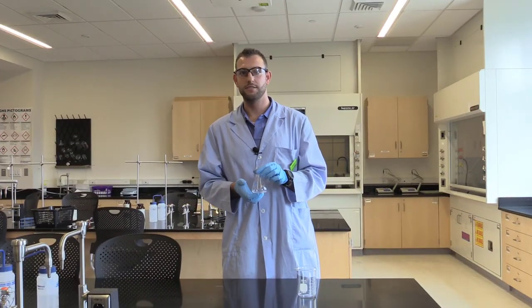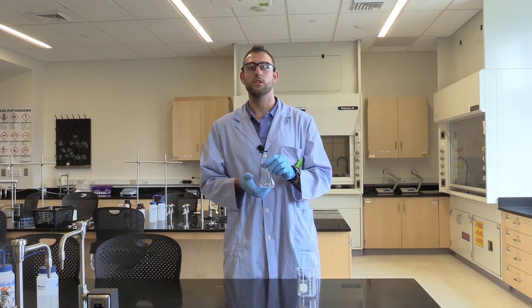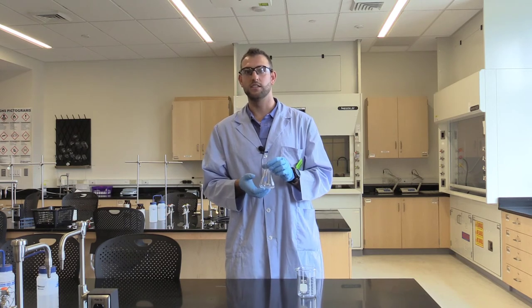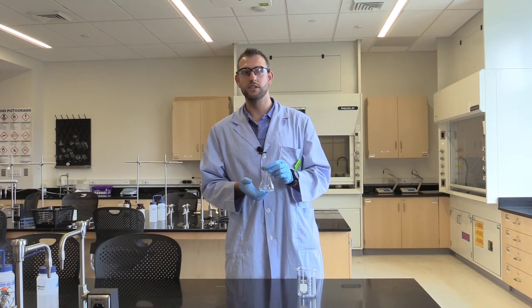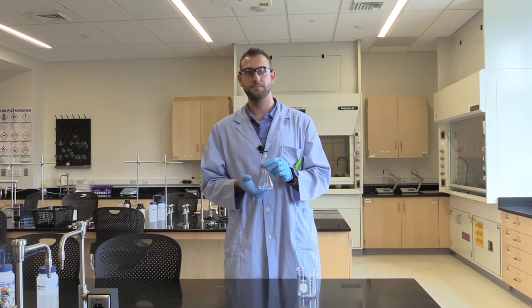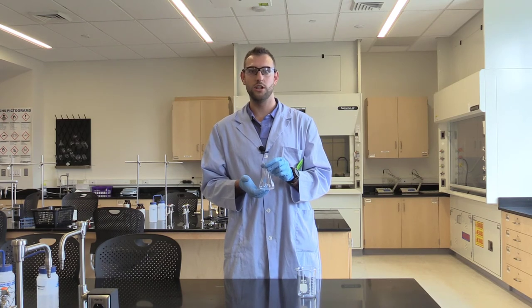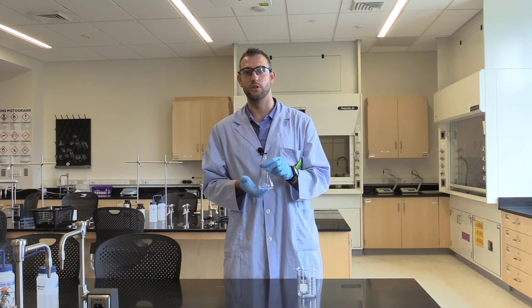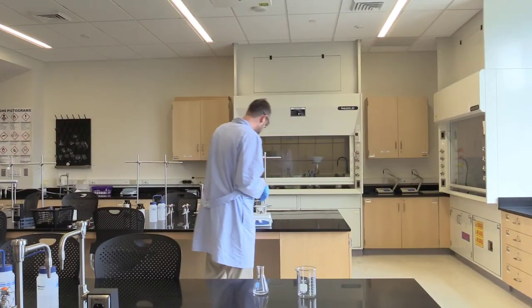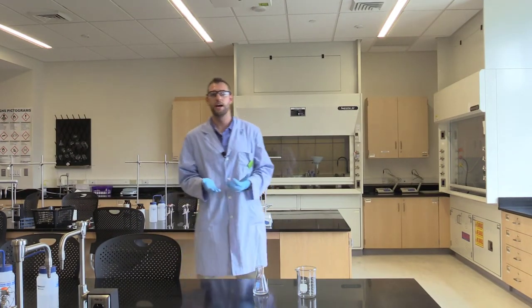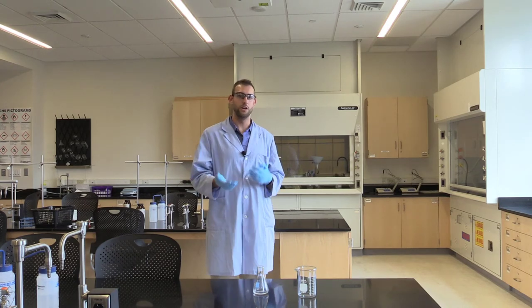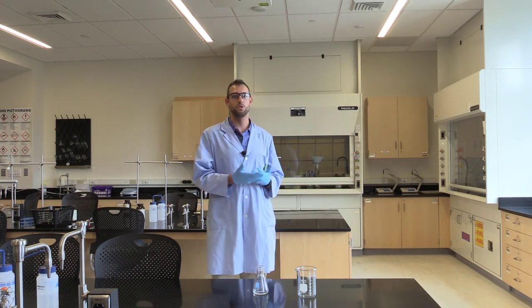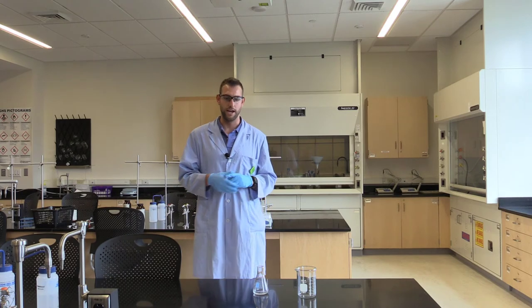Here I have now weighed out my salicylic acid, the five mL of the acetic anhydride, along with the catalytic amount of sulfuric acid. It looks like our temperature is set, so now we can put our flask into the water bath to start the reaction.